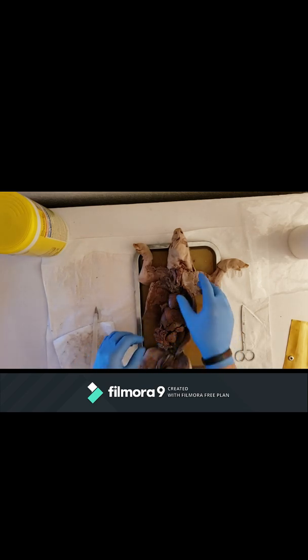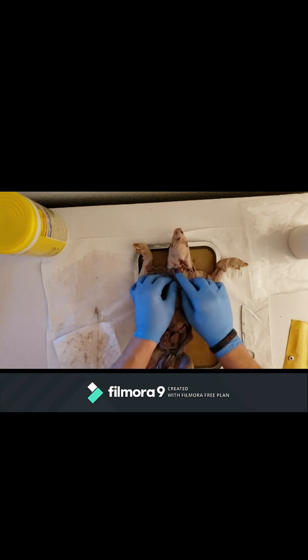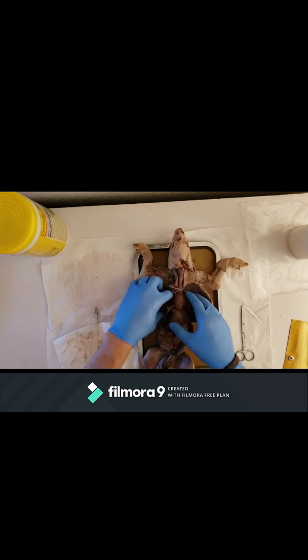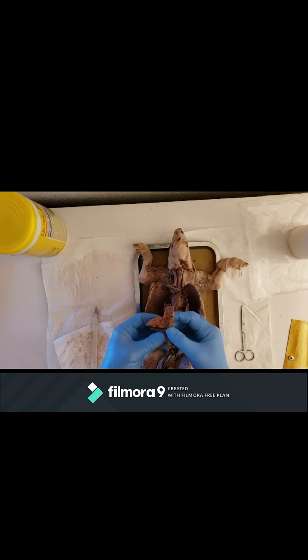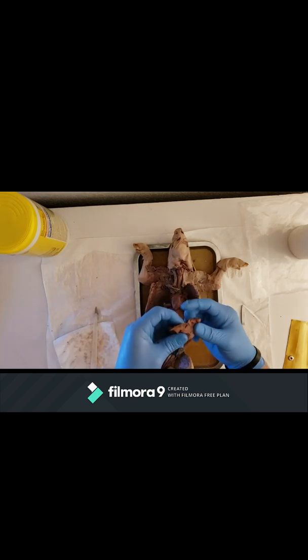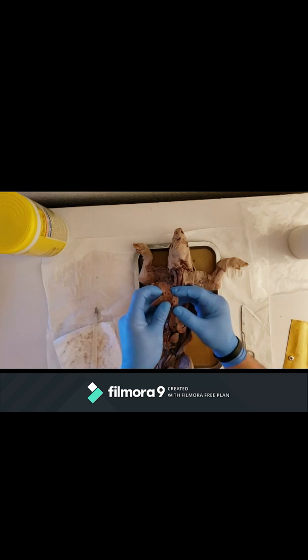So moving on to the respiratory system, you have your larynx, which is like this lump. This is your trachea and your lung lobes. I actually removed a lung to make this next part easier. So you have three lobes per lung, left and right. In here, we already covered this thoracic duct. Your hilus is this region where all of the blood vessels and anything that comes into the lungs is here.